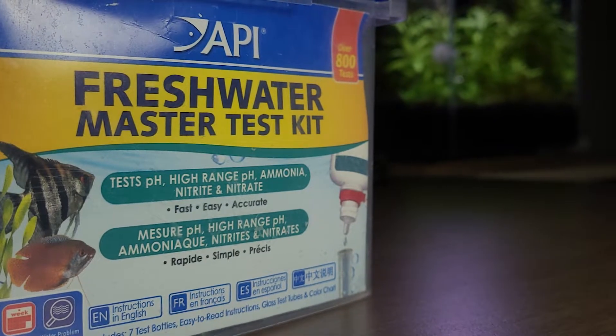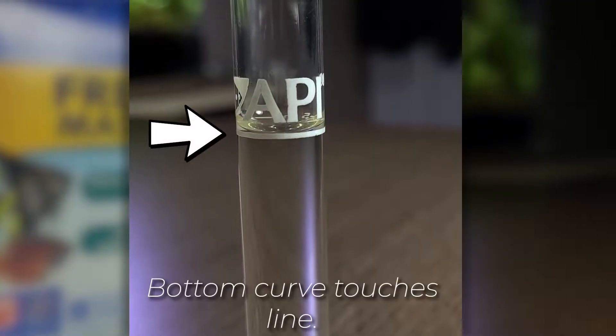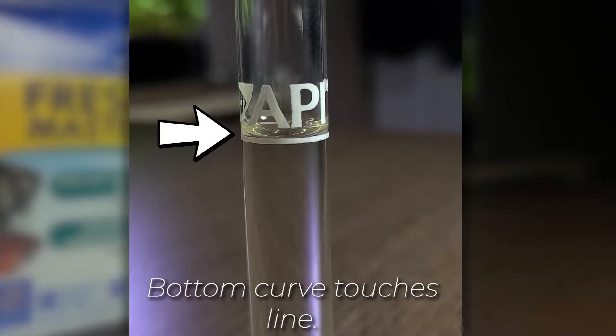Before we start testing, please make sure that the meniscus of the water touches the line as indicated, otherwise you may not get an accurate result.